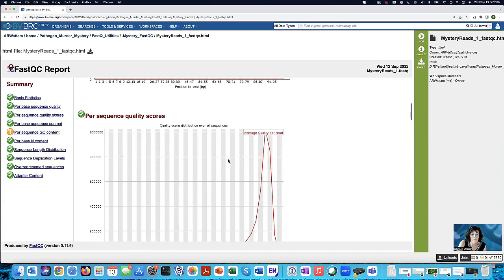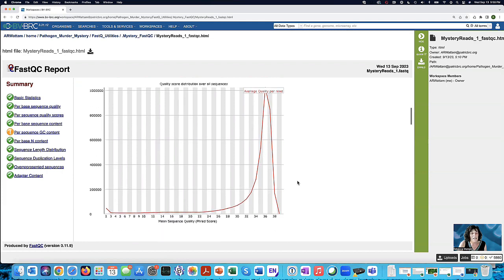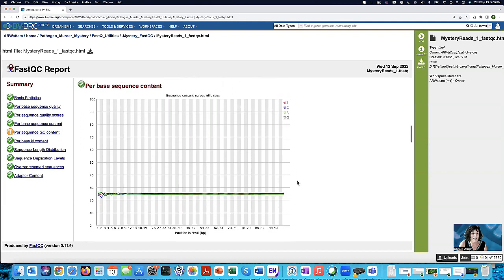And then you have per sequence quality scores. Let me point out at the side, if it's got a green check, it means this looks good. If it's got this exclamation point in yellow, it means there's not a lot of concern, but a little bit of concern. And when it's bad, it'll have a big red X, and we don't want that. So per quality sequence scores, that's looking across each of them, and that's what you want to see, or that's what they say you want to see.